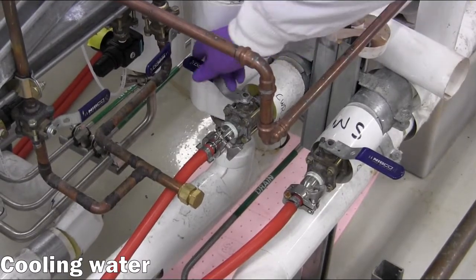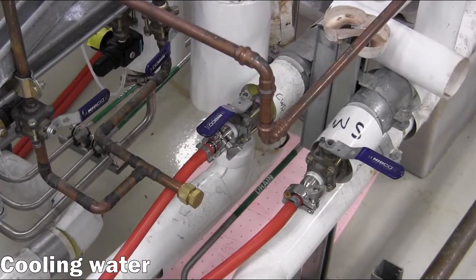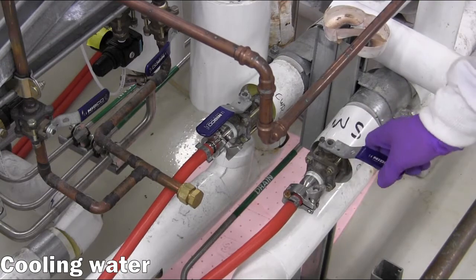Both valves for the chilled water supply and return are open to allow recirculation to the house system.